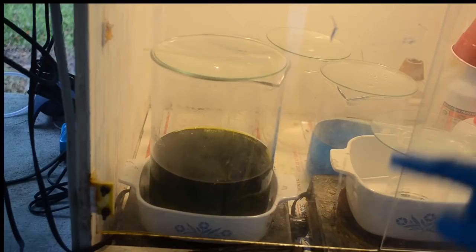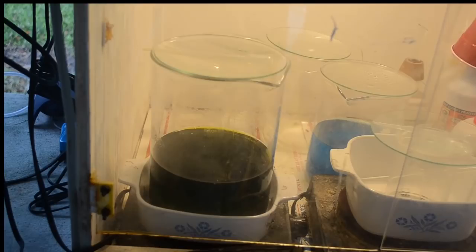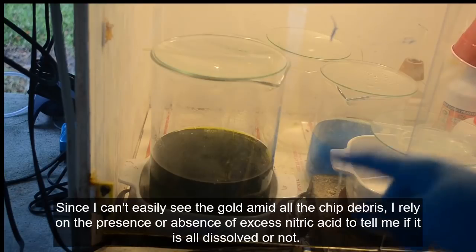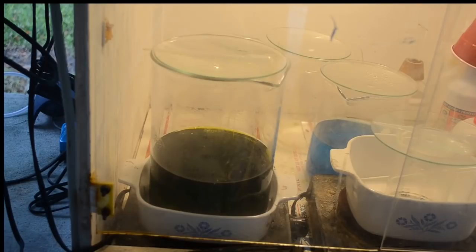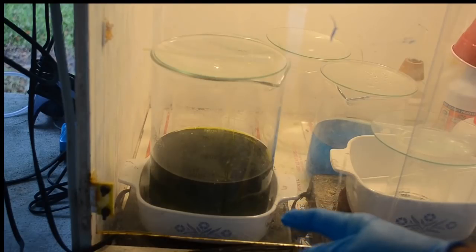probably gone into solution. If there's no excess nitric, that's going to tell me that maybe I didn't get all the gold in solution. All of the nitric acid that was in there was used up. There might still be some gold there. So I will mix up a saturated solution of sulfamic acid. We'll pour it in there and see if we get a reaction. If we do get a reaction, then I'd say probably all the gold's in solution. If we don't, then I might have to do another extraction on that.